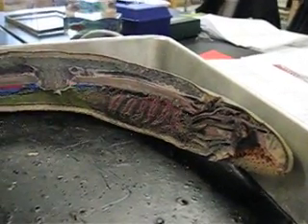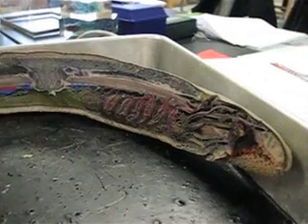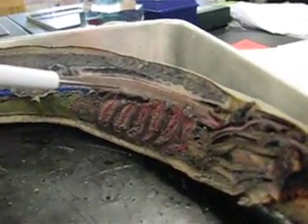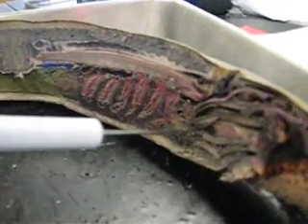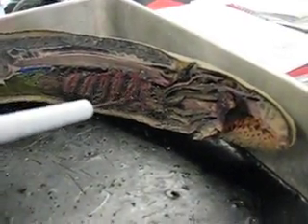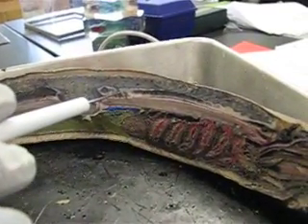This is the lamprey musculoskeletal and nervous system. Here are the myomeres. Here is the notochord. This is the lingual muscle. These are vertebral elements — they stem off the notochord.